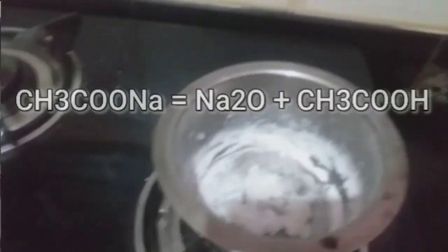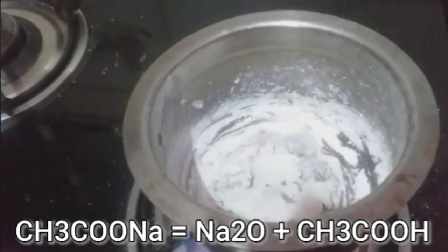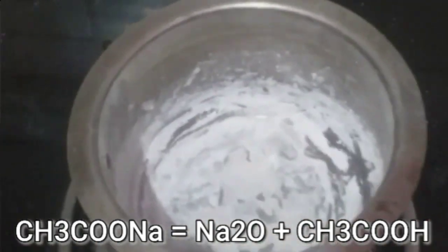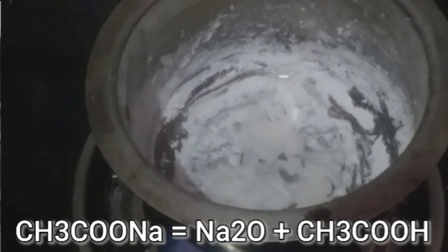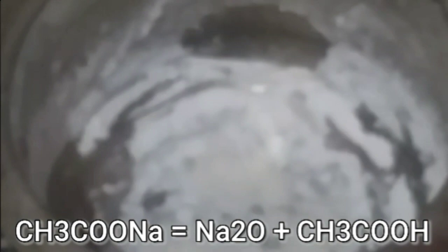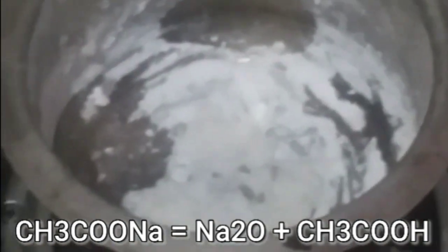Let's see the chemical reaction. Sodium acetate, CH3COONa, when you heat it, it will decompose. It is equal to Na2O plus CH3COOH. So when you heat the sodium acetate and it decomposes, it gives sodium oxide and acetic acid.